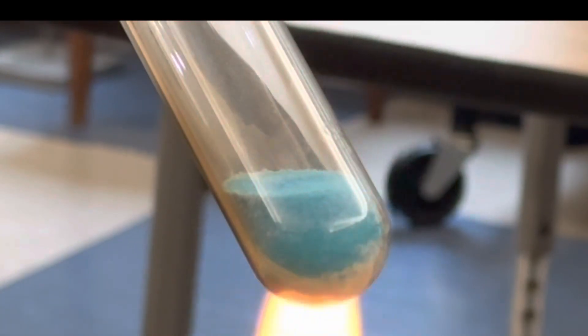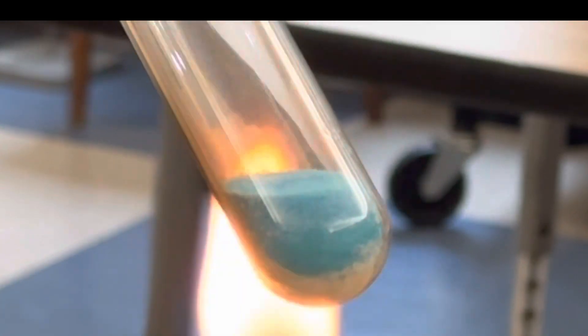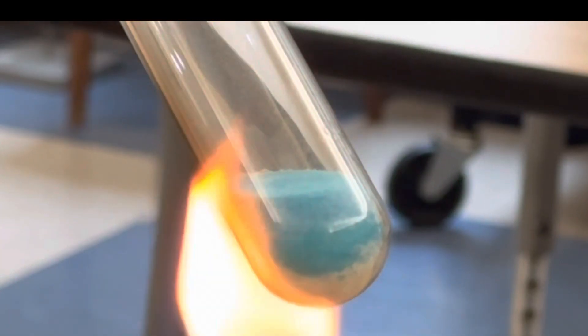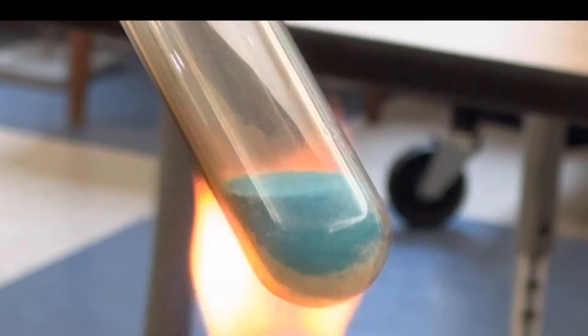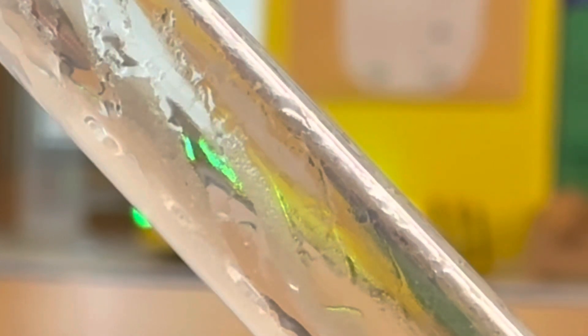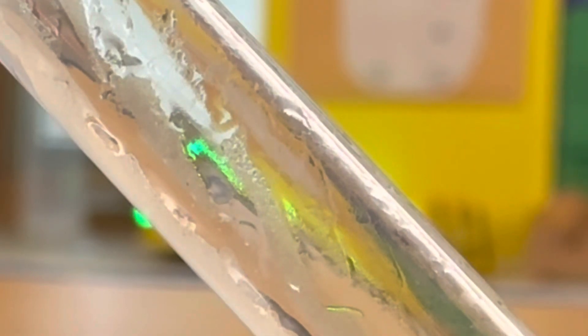Those five water molecules per molecule of copper sulfate start to evaporate out of the compound. You can start to see a lot of condensation forming in the test tube as those water molecules begin to evaporate.